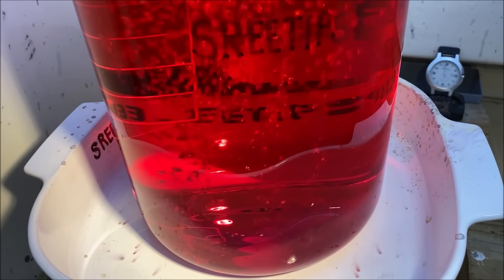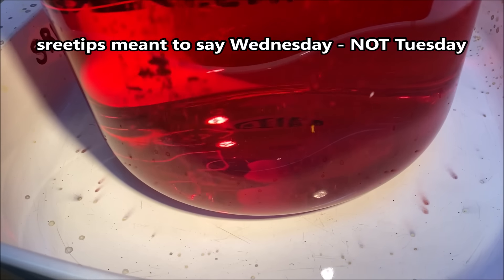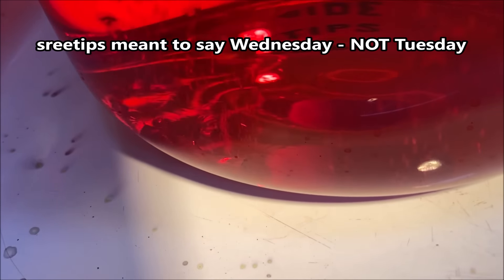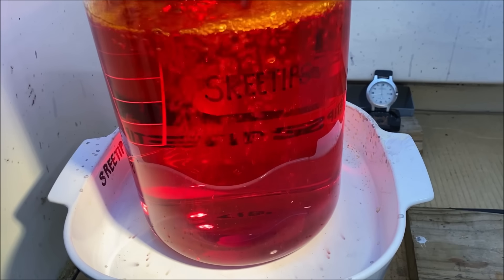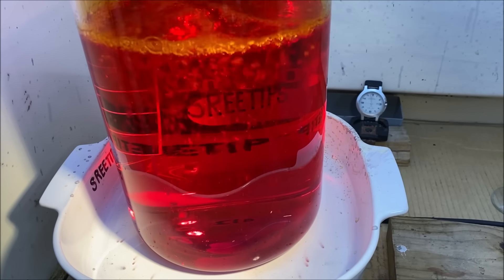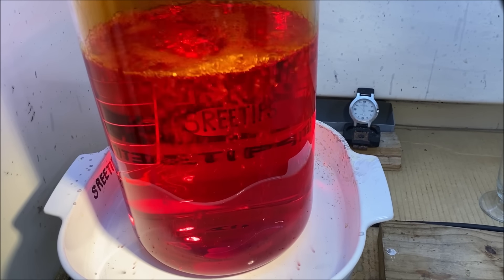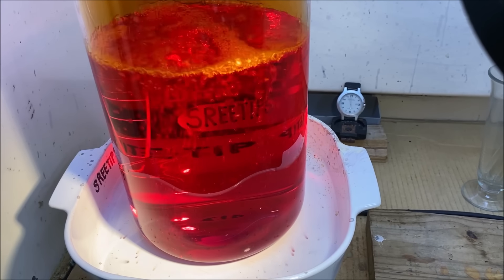I started this process at about 11 o'clock on Monday — today is Tuesday — and all I have left down there is a tiny sliver of the brick of gold that I put in. It's almost completely dissolved. Now what we're going to do, when all that gold goes into solution, is evaporate this down to dryness to form chloroauric acid crystals. We'll put the time lapse back on and continue this experiment.